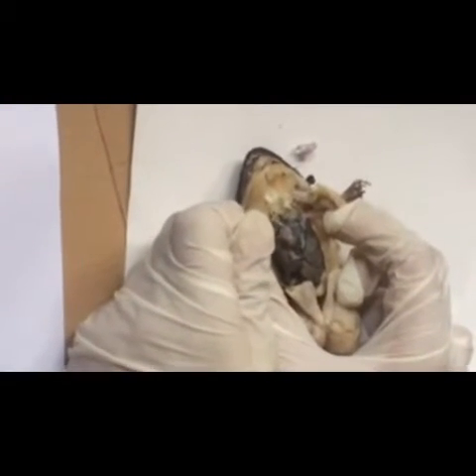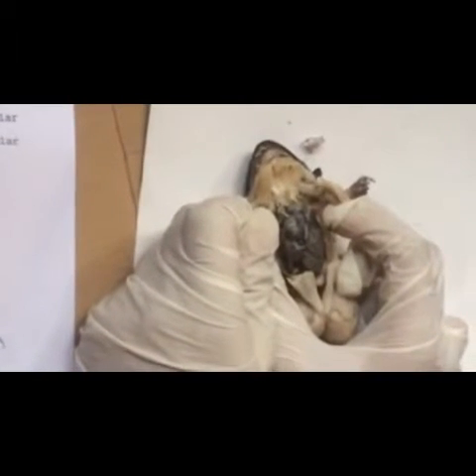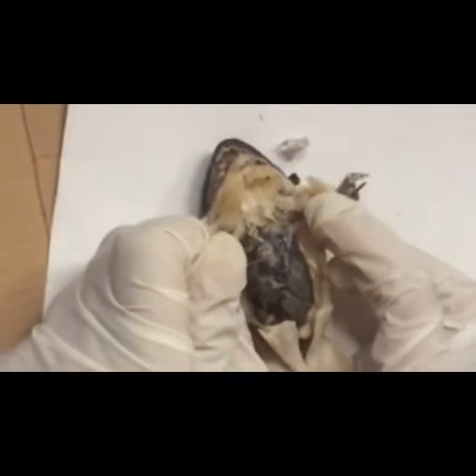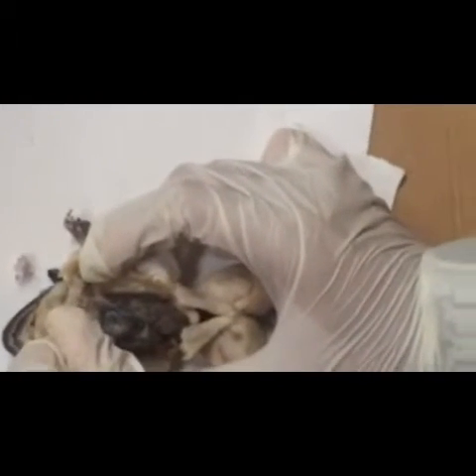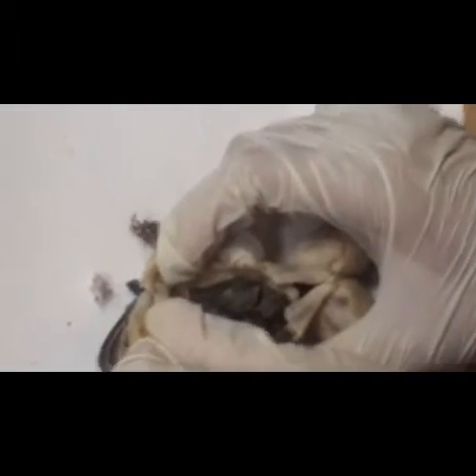I'm going to discuss about the heart of a frog. As you can see, it is quite different from the heart of a human, because a frog's heart is only composed of three chambers, while in the human it is composed of four chambers. The left precava is located right up here. Blood will enter the left precava, which is deoxygenated, because it is already used by the internal organs of the frog.